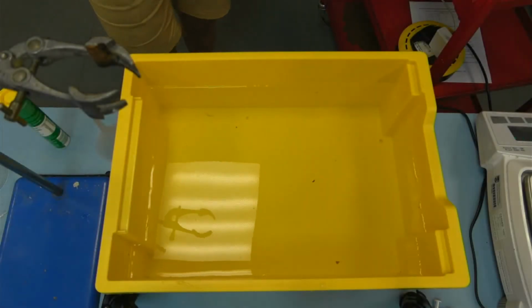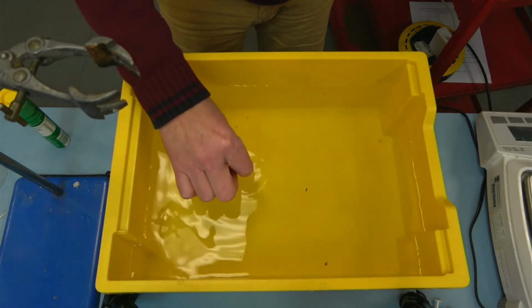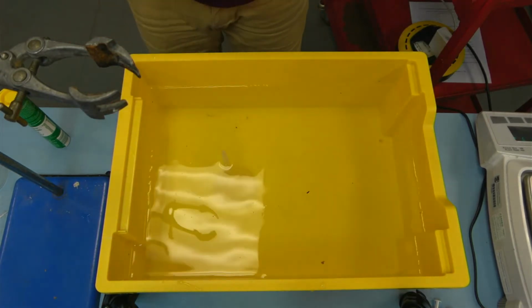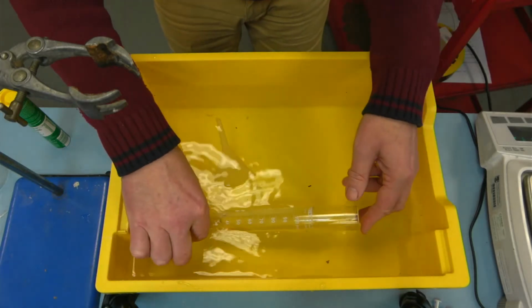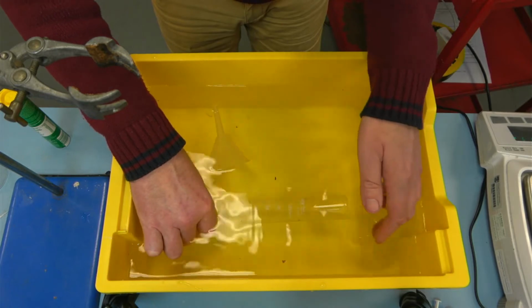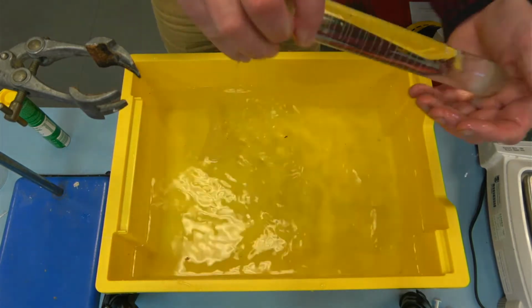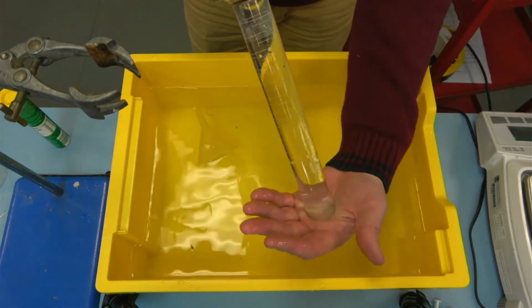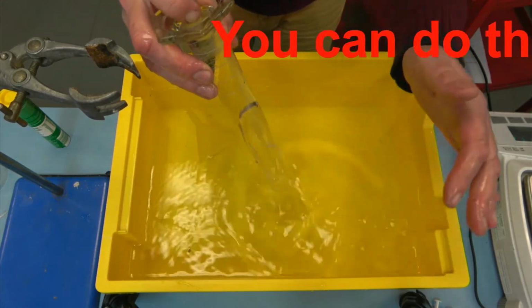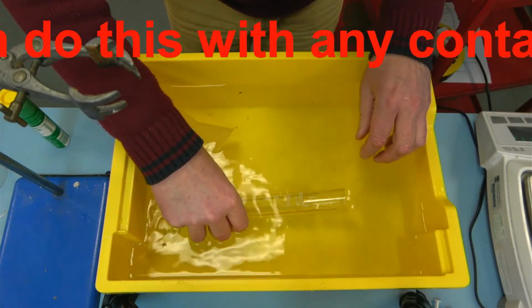Okay, for the next step you need a container of water. Now your funnels are about this big, and if you put the funnel in it just about covers it, but being plastic they do float around a bit, and you will have a measuring cylinder. So fill the measuring cylinder up with water so there's no air, put your hand over the end and you can do that. So the measuring cylinder is now upside down, completely full of water. Now obviously if you let go, all the water falls out. So you need to make sure that the water stays in.